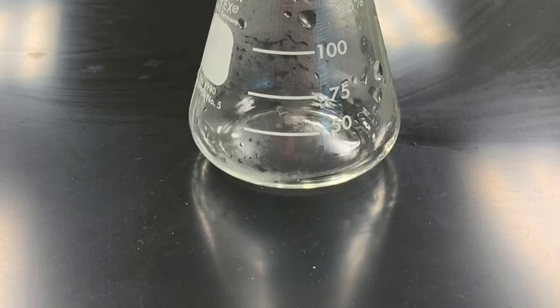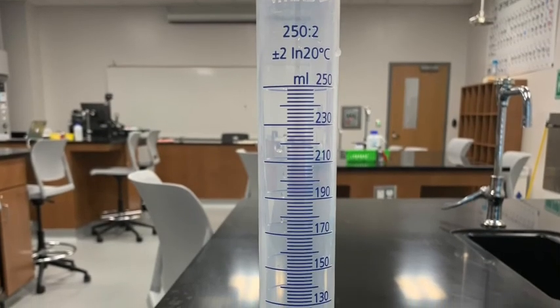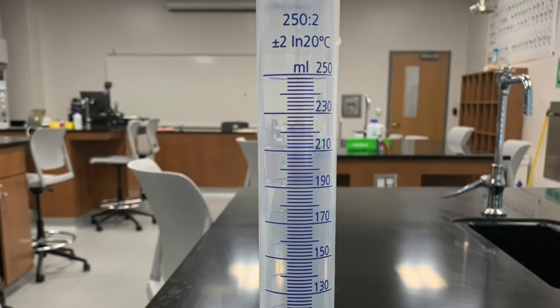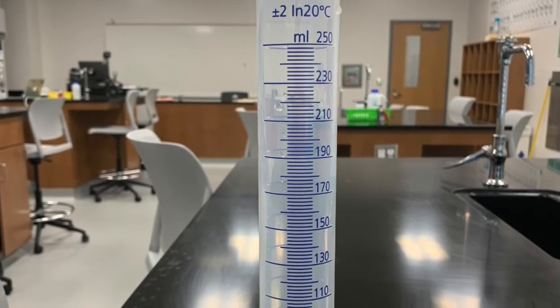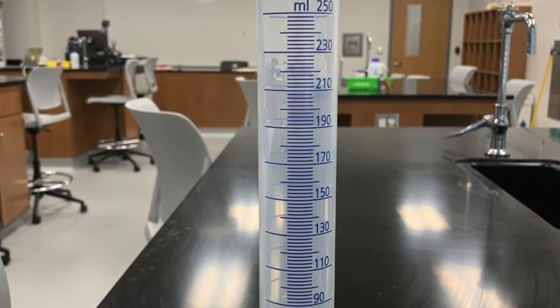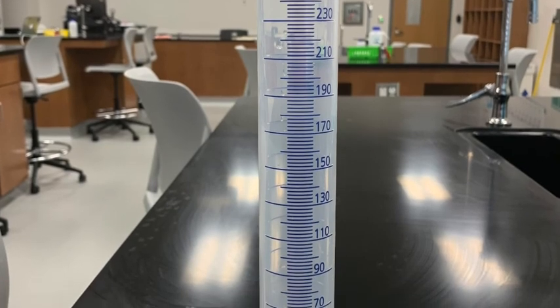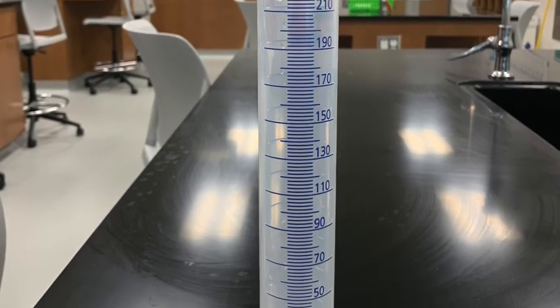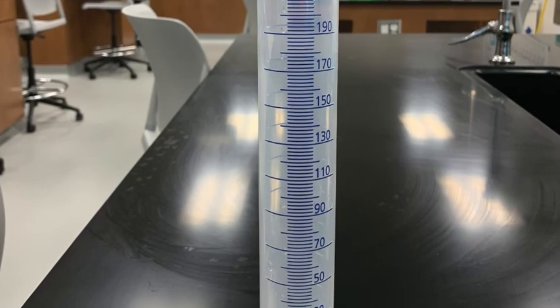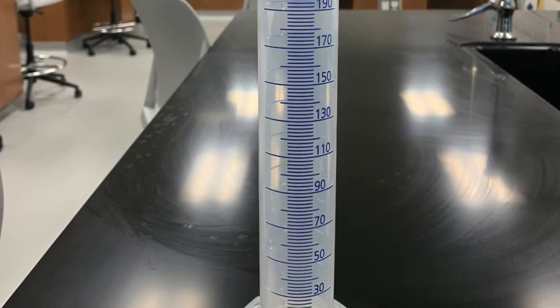It is a 125 milliliter flask, but we need to find the exact volume of that — it's not going to be exactly 125 milliliters. We'll have to use a graduated cylinder and fill it up with water to figure out that exact volume.